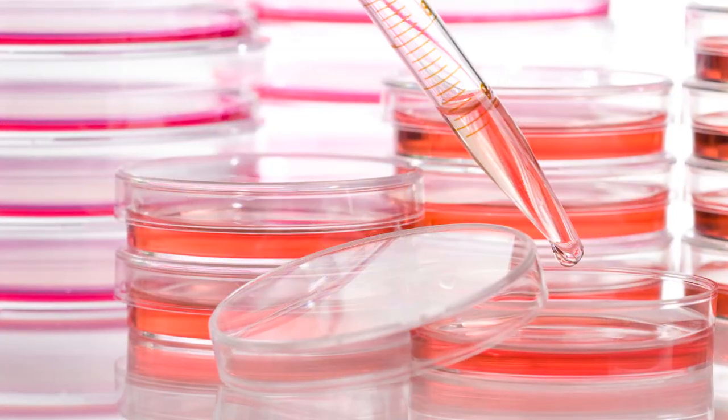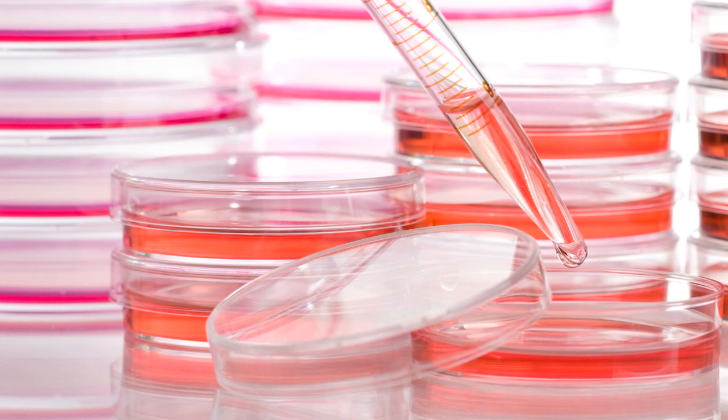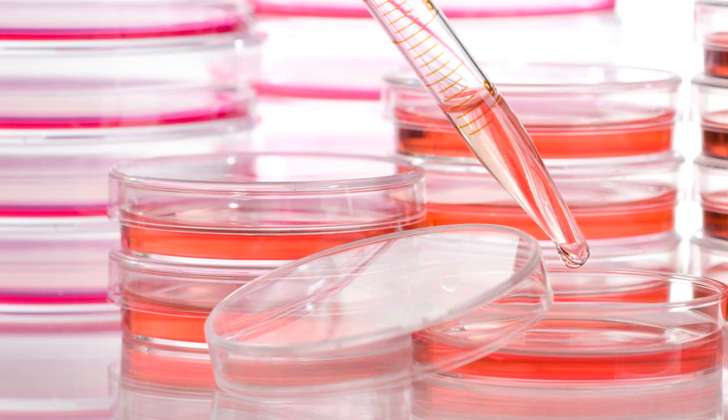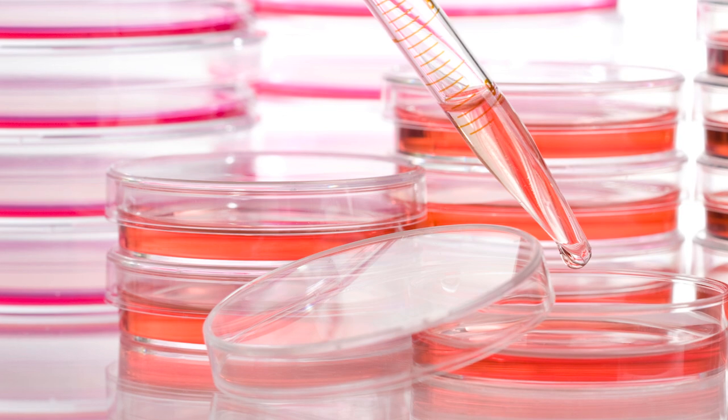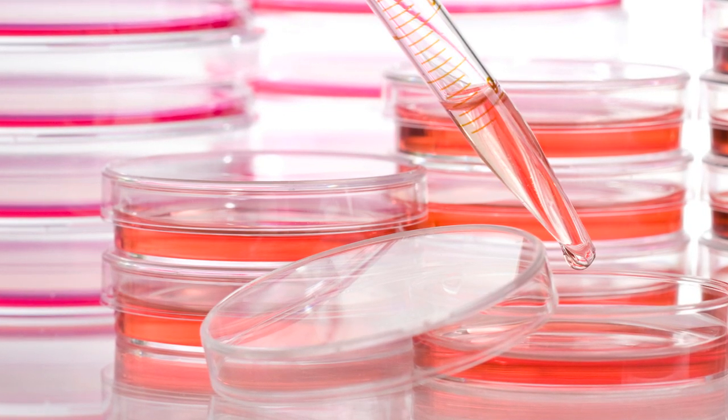Human tumor cell lines are commonly used as model systems to study the phagocytic behavior due to their simple culture and amenability to manipulations. In this case I will show you a phagocytosis experiment using the monocytic THP1 cell line.